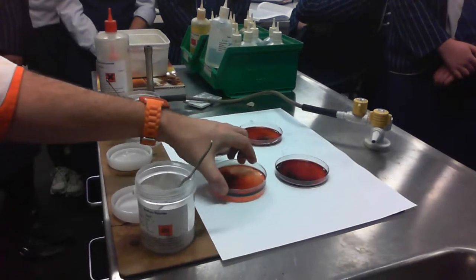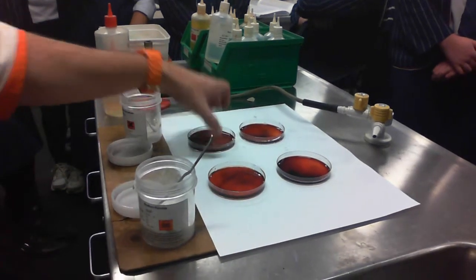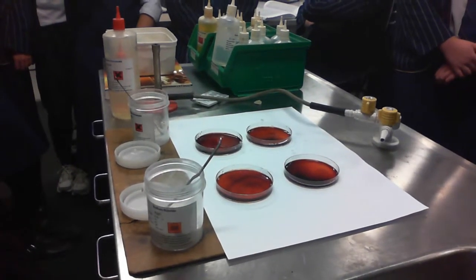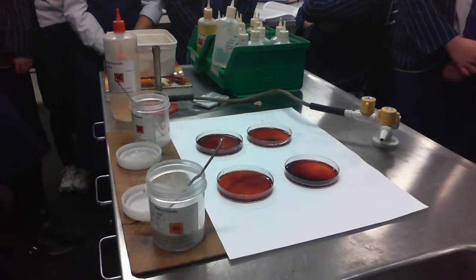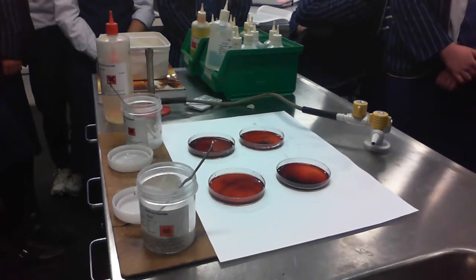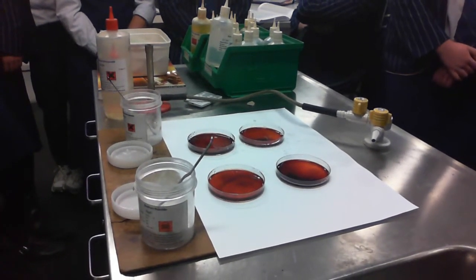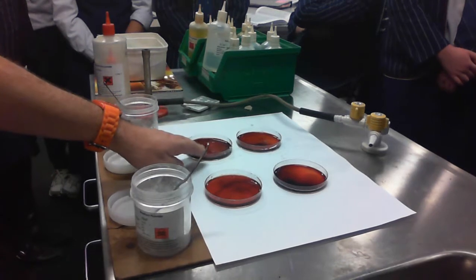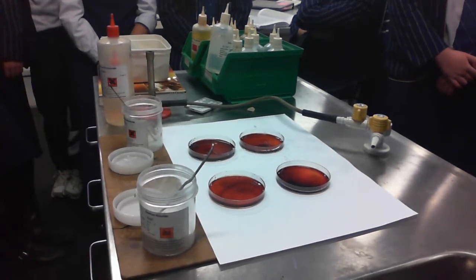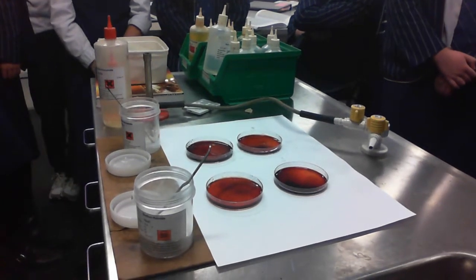So I've tried to make 4 different solutions that are nearly the same concentration. What we're going to do is try to mess up those equilibria by adding certain things to them. Keeping in mind that they're a similar concentration, we'll consider one of these to be our control. Let's say, for argument's sake, this is our control. So we're trying to see if it goes darker or lighter than that. So in our experiment, what was the first thing that we were told to add to it?